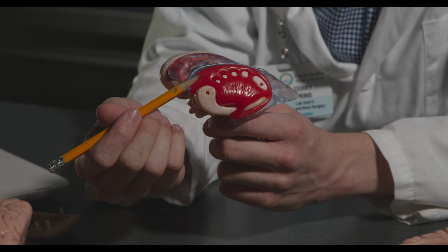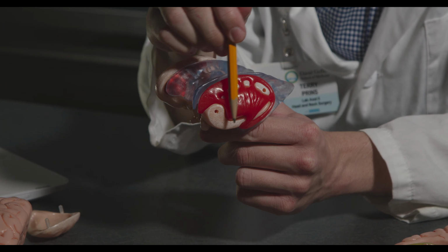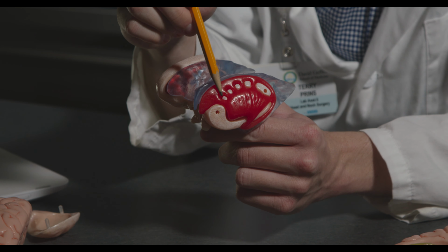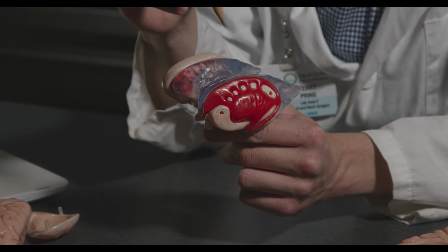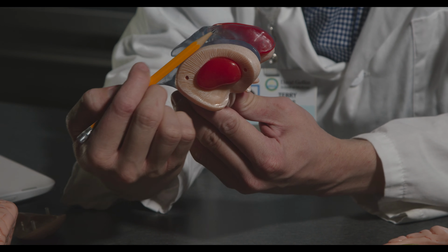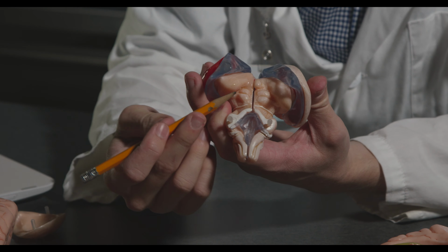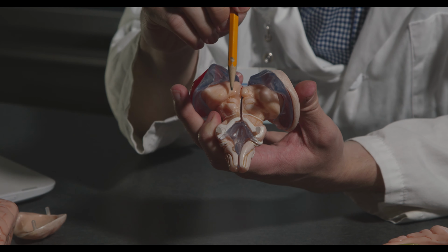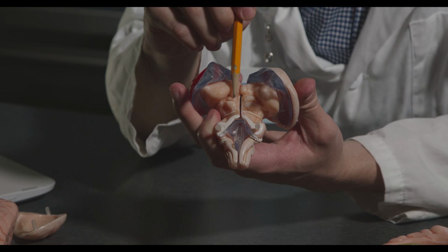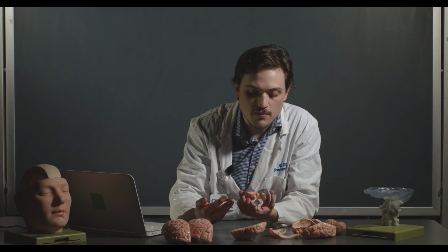This is going to be covered extensively in one of your later labs, but you can see the caudate here, the putamen, and some of these striations where you can start to see some of the white matter coming through. You can see it really prominent on this side. That's essentially going to be the internal capsule. On the dorsal surface of the brainstem here, we can see the pineal gland and then the tectum, the superior and inferior colliculi. So there's a lot of stuff that you can see on something like this brain model.